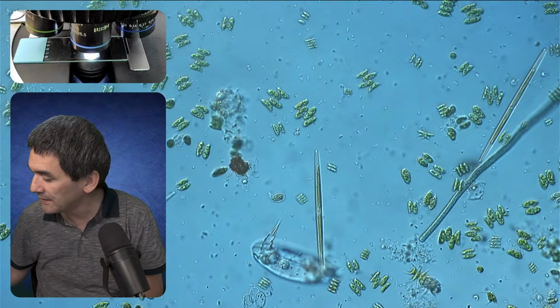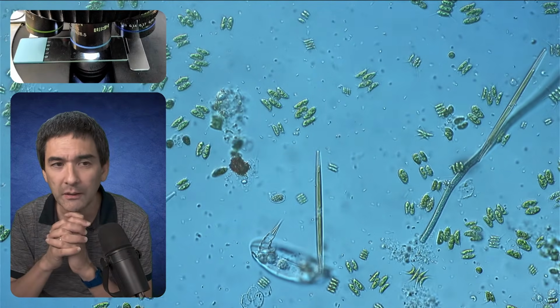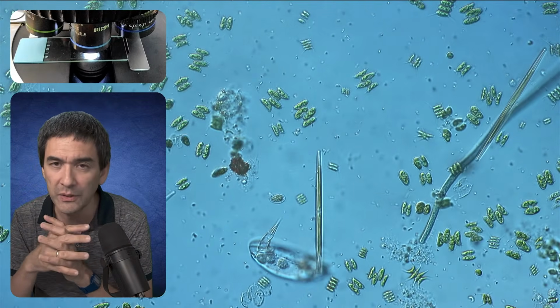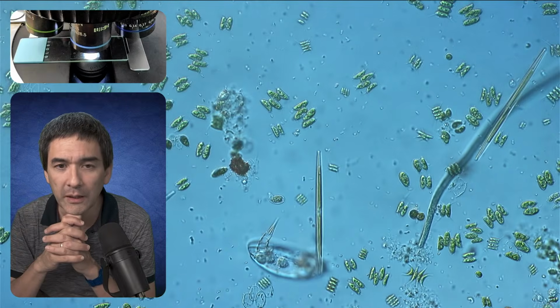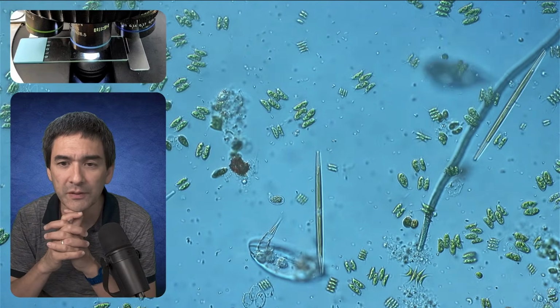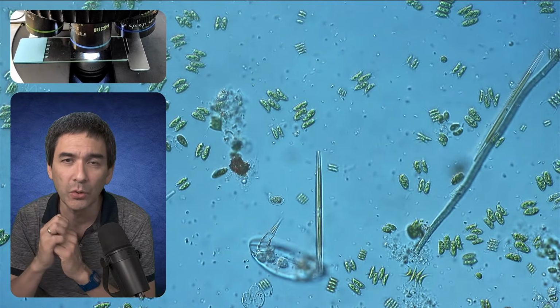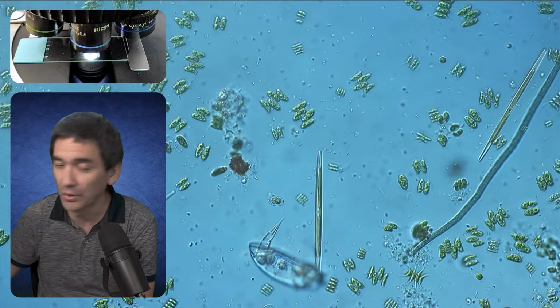A couple of days ago, I also uploaded a video about the oxygen requirement of bacteria. If you're interested, you can watch that after the live stream, where I specifically looked at the movement of those bacteria in the background. They started to form so-called aerotactic bands, and we're going to see if this also works here right now.